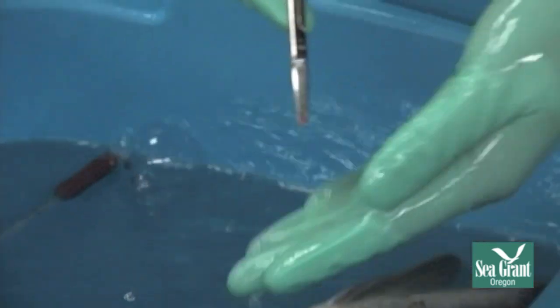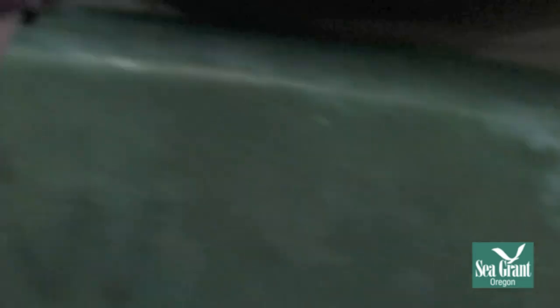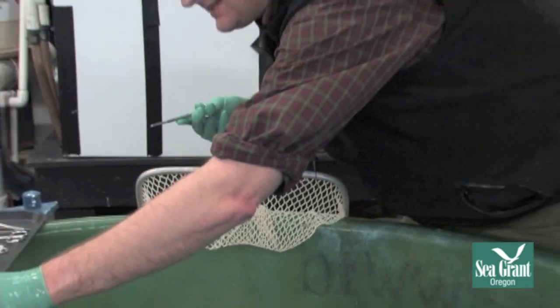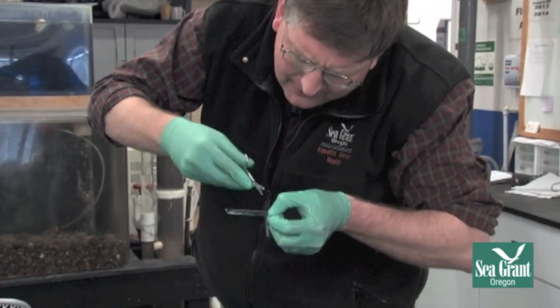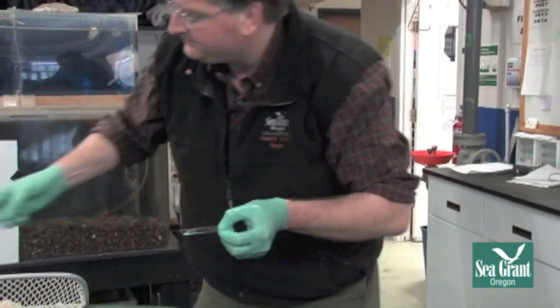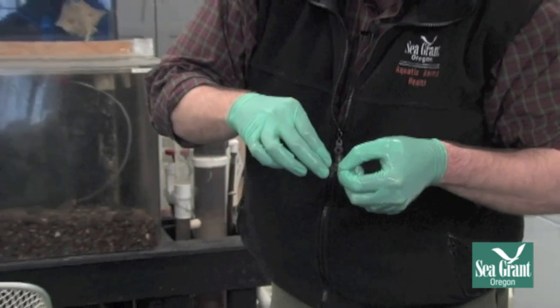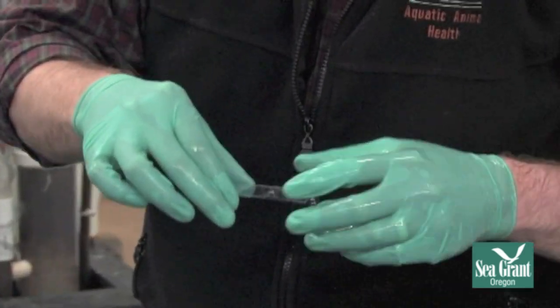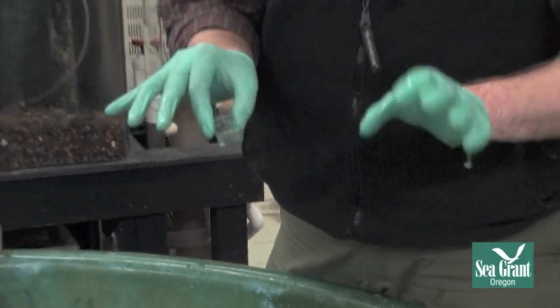You see that? It's right there. Then I take a little drop of water and put it on the slide, get the gill biopsy right on the slide, take another cover slip and just drop it down — that spreads out the gill biopsy right there. Then I go look at it under the scope, again within five minutes for the same reason: you want to see movement.